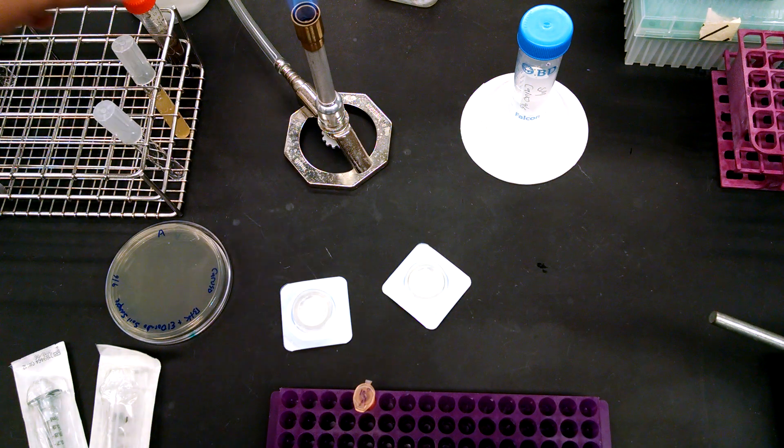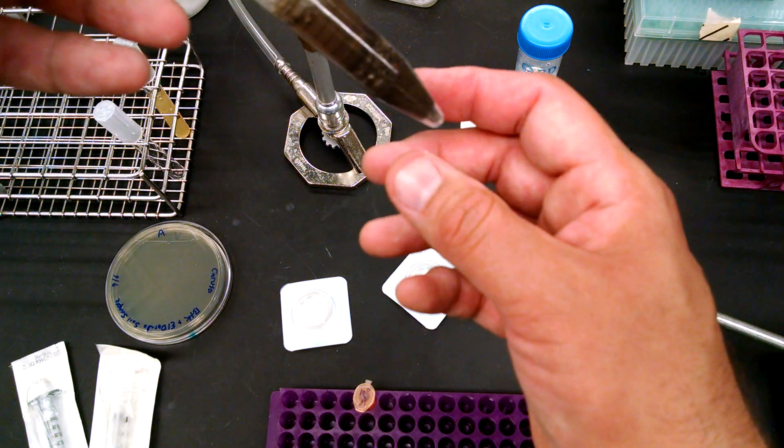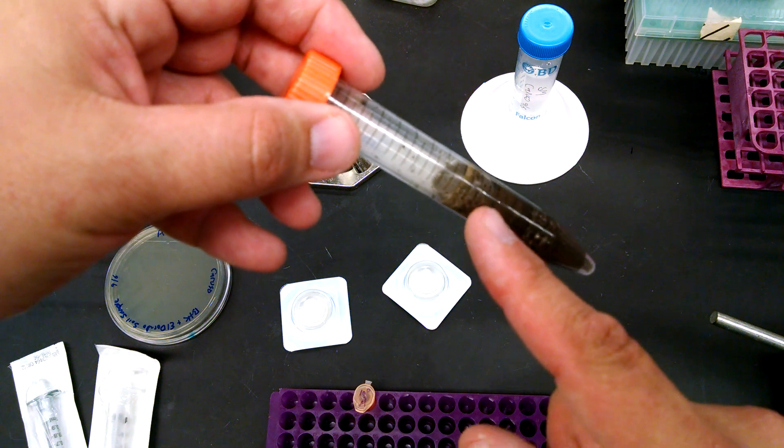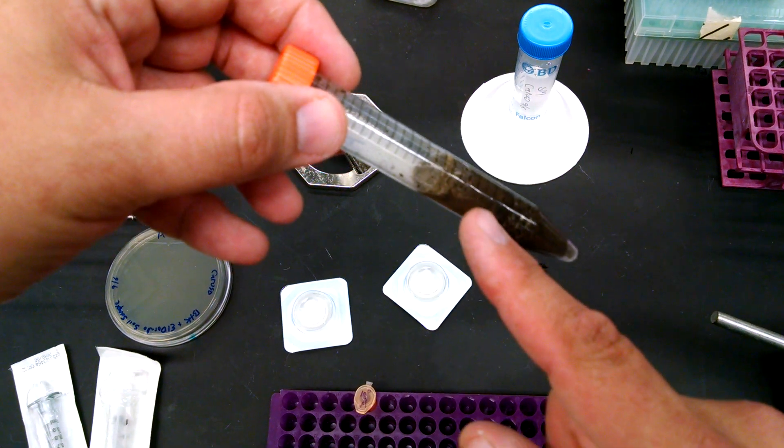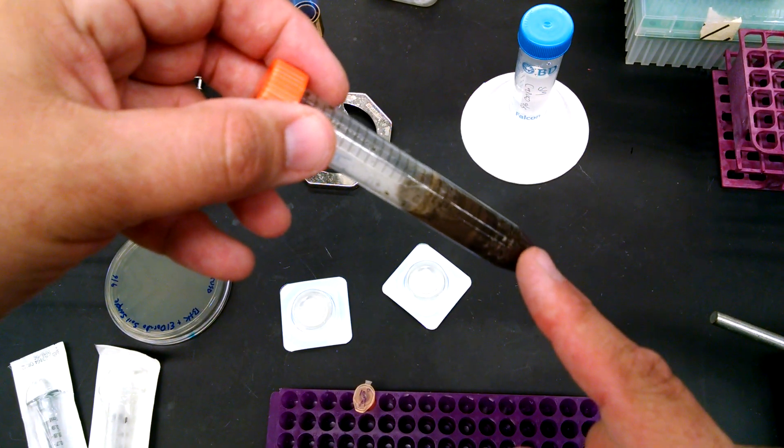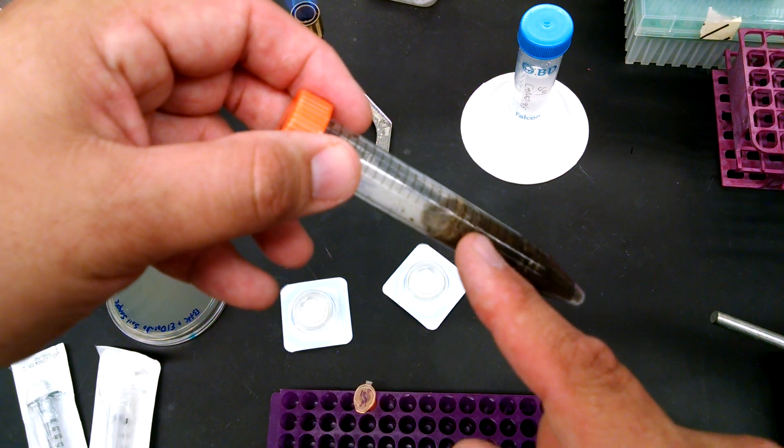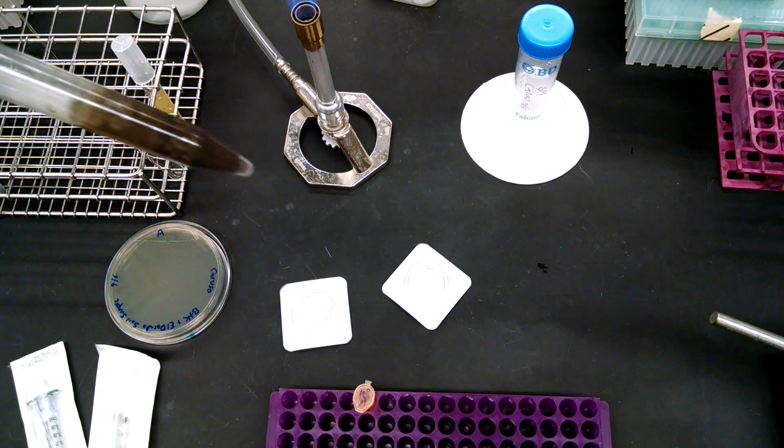Because right now you couldn't pipette this or push this through a filter without destroying the filter. So you're going to let it sit, and what will happen is eventually you'll get a layer of the wash, okay, the buffer that washed this soil. That's hopefully got some phage in it, and that's what we're going to test.